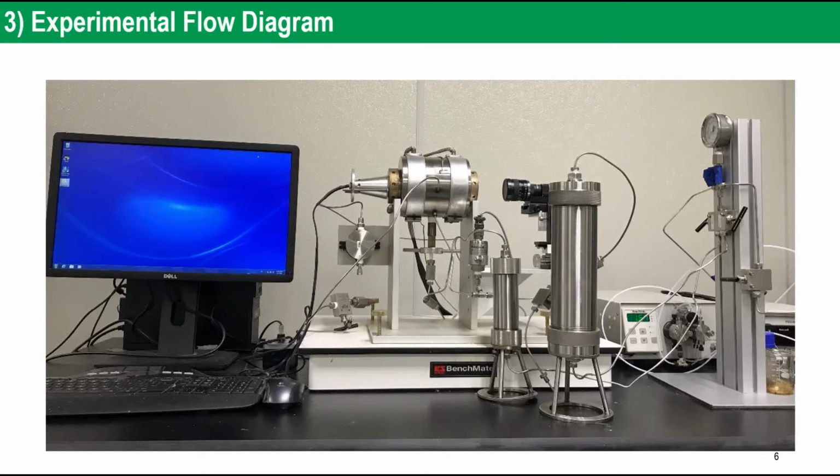Now, let's get familiar with the different parts of the experimental setup. The schematic figure is shown as follows. The pendant drop tensiometer is composed of an IFT cell, which consists of a light source, a chamber to load the two immiscible liquids and a camera to capture the high-quality images used for later analysis; a pump to inject the liquids, a controlling panel, two accumulators to store the two different liquids, and a data acquisition and analysis system.